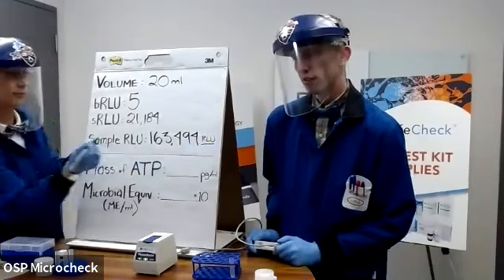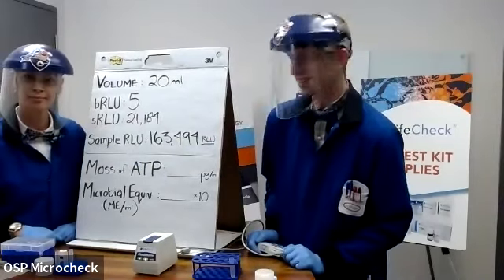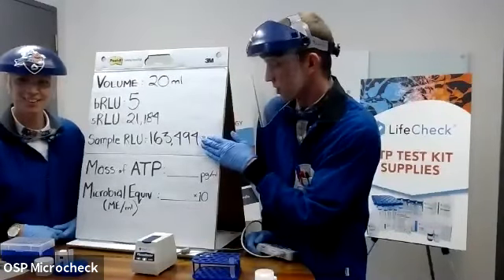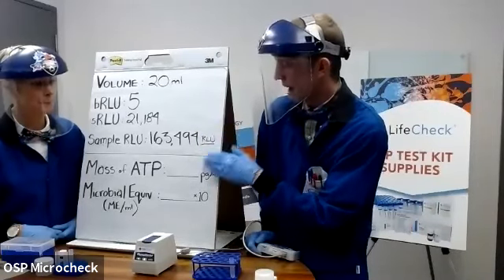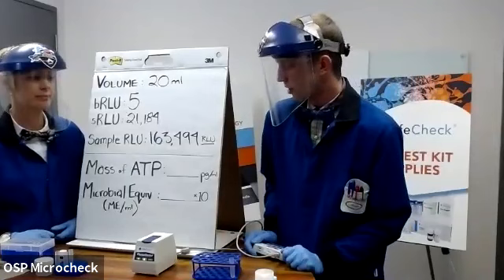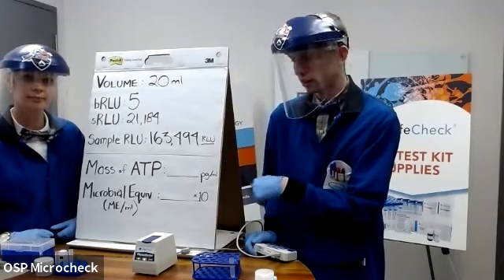All right, awesome. We have a reading now of the amount of ATP in our sample. 163,000 RLUs. What does that mean? I don't know. So the direct value that comes out of the instrument isn't what's useful. What's useful now is taking that information and calculating it back to a unit that does provide information that you can then make a decision on, understand the mitigation processes you have in place and how they're affecting the microbial community. So the calculator spreadsheet that I mentioned earlier will automatically do this.